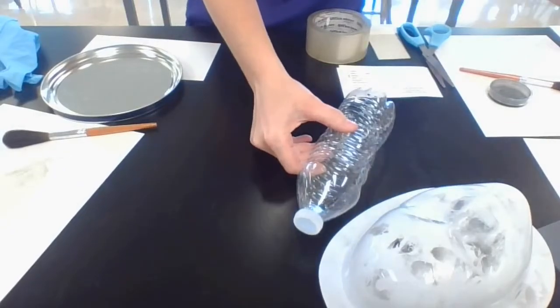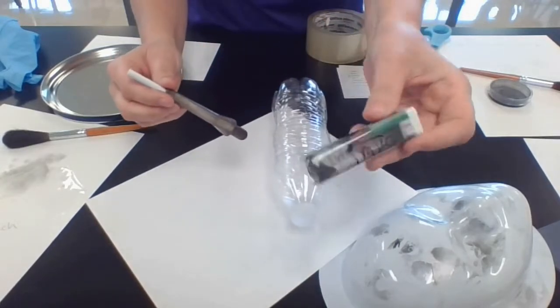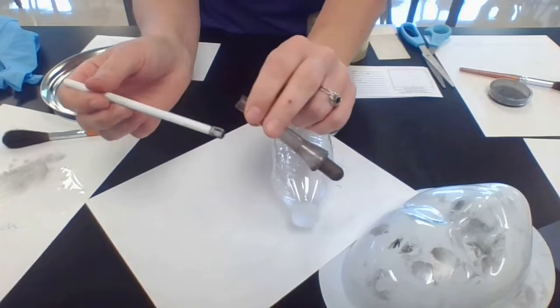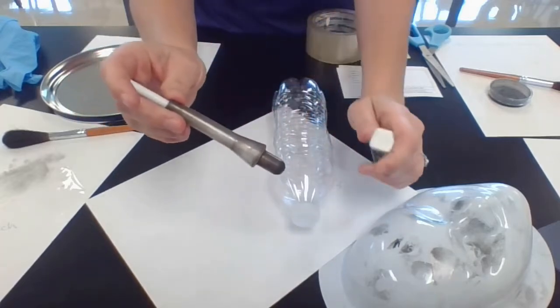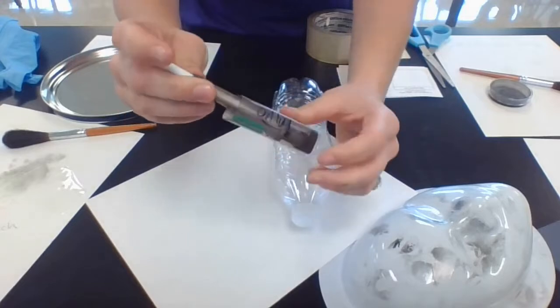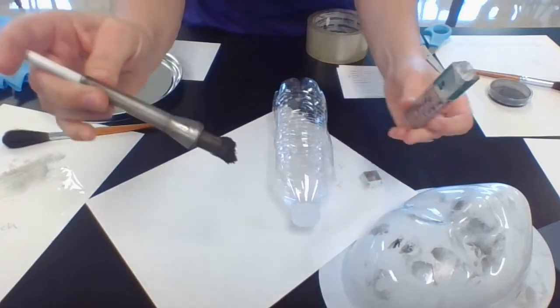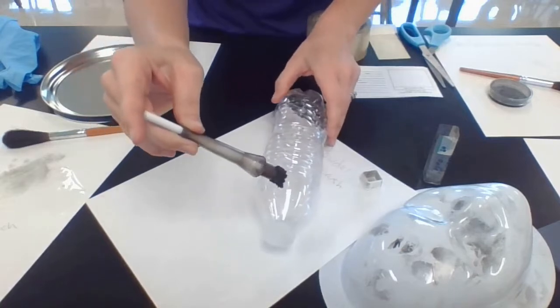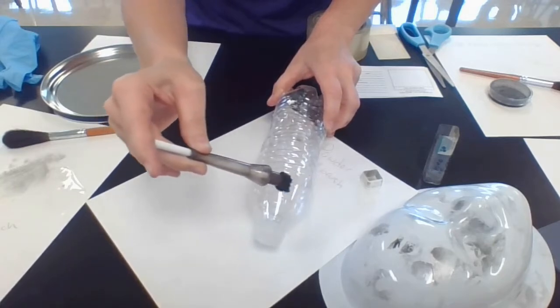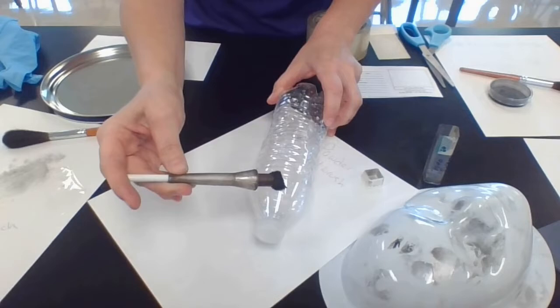Here's our water bottle. I have my magnetic powder — I'll show you some so you can see the contrast. This is magnetic powder in a little vial, which keeps it contained, and then we have a magnetic wand. This wand has a slip on the outer side and the magnet is at the base. The slip stays on the metal wand and allows us to direct the magnetic powder better. I'm going to pick up the magnetic powder with the magnet inside the applicator wand. You want a good amount of powder, and then you just drag it slowly across your fingerprint. You don't want the applicator itself to touch the fingerprint — just the powder — and I can start seeing the fingerprint slowly developing.